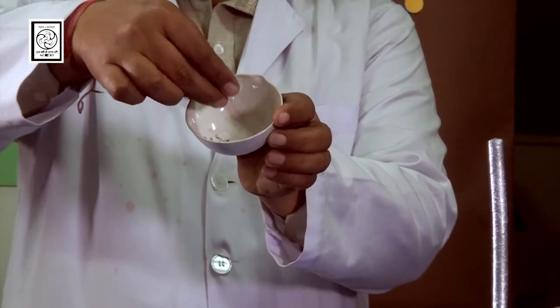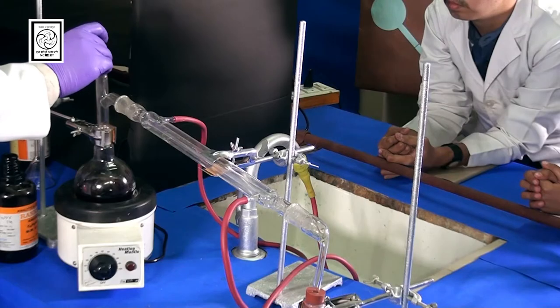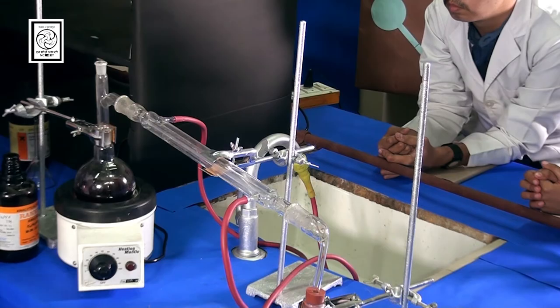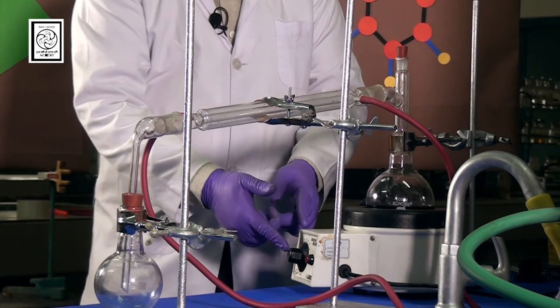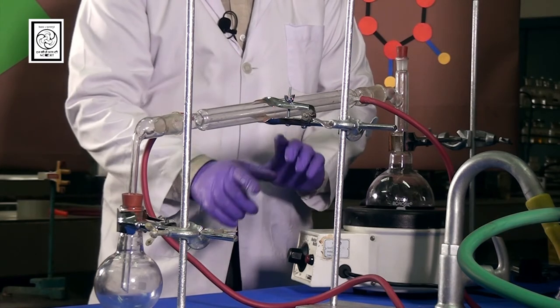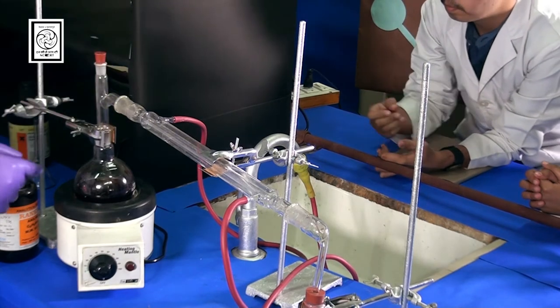After adding aniline, these are porous porcelain pieces. This should be added to the liquid. Okay. Before I initiate the heating to the liquid, Gaurav, please switch on the tap.